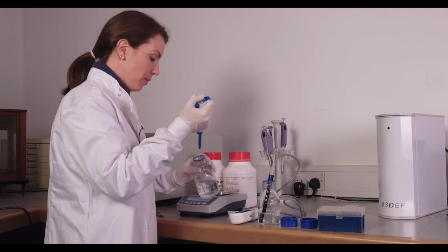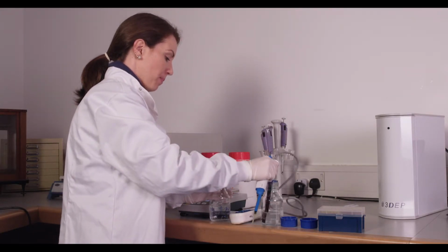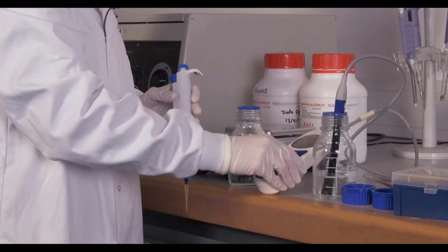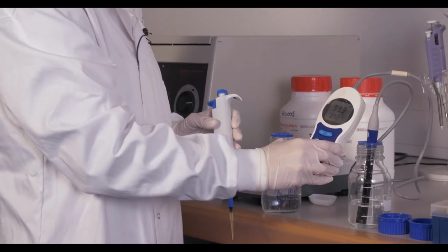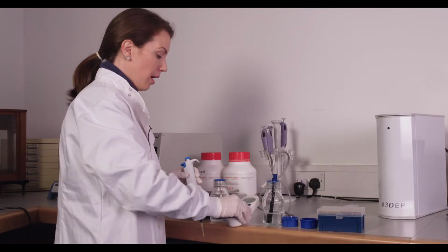So I'll add just a bit more. And now we're at 99.4. So that's close enough to 100.